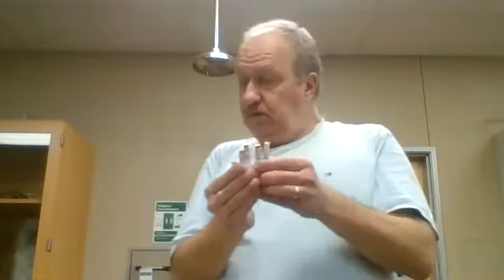But what we have are our 5 antibiotic discs. And so what you want to do is on page 205 of your laboratory book, you want to write down each antimicrobial agent. The first antimicrobial agent is bacitracin, and the disc code for bacitracin is B like boy 10. The second one is tetracycline, and the disc code is TE, like T like Tom, E 30.